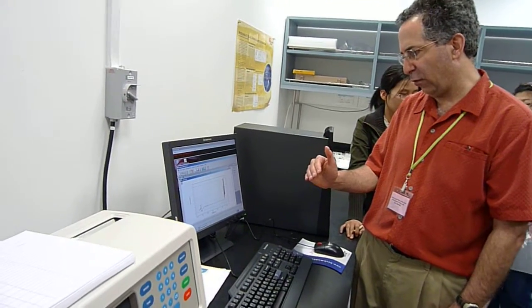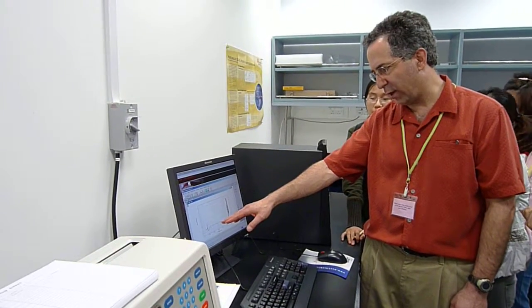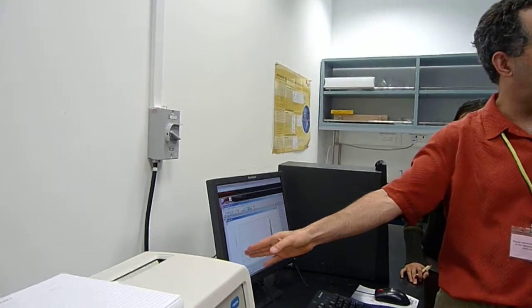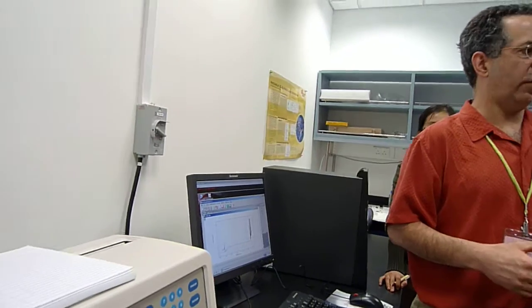This sample 4, I see something else that's happened at rotor speed. The absorption is right, but something happened that I was a little bit worried about. It looks like the channel between the reference and the sample has leaked together. So it's mixed. I noticed, I don't remember which of the cells, that on one of them there was a bit of dirt caught in the windows when they were put together, and that can act as a channel. So you can see now the sample and reference are the same. That is not a huge problem. It might still be analyzable.